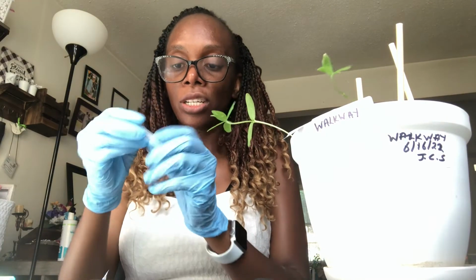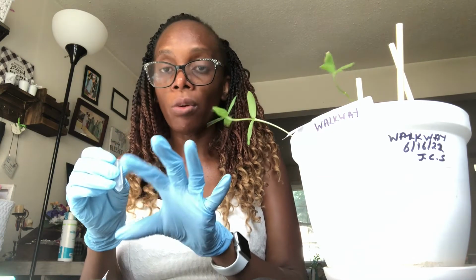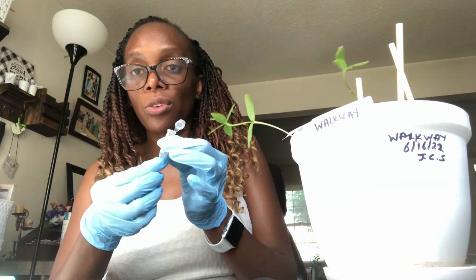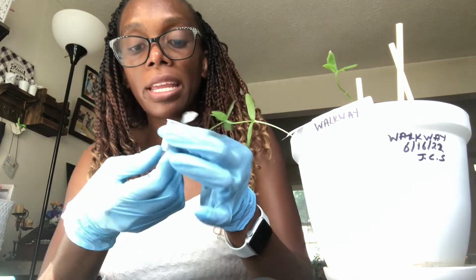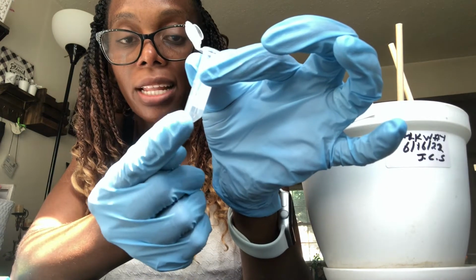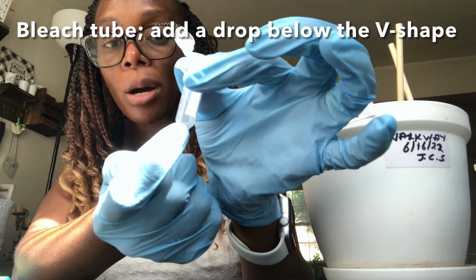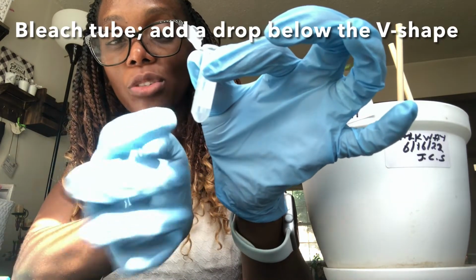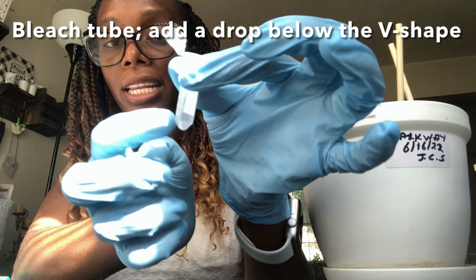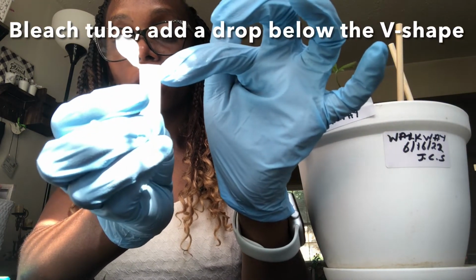Next is the bleach tube. So like we said yesterday, you only want very little bleach and a lot more water. It has to be diluted, so a drop or 2 drops should be way below the 0.5 mark. You know how there's this little V shape? You want your drop to just be at the bottom, and it should not even reach that mark. If it reaches that mark and you can't take it out, then just make sure you fill this up to almost the brim.